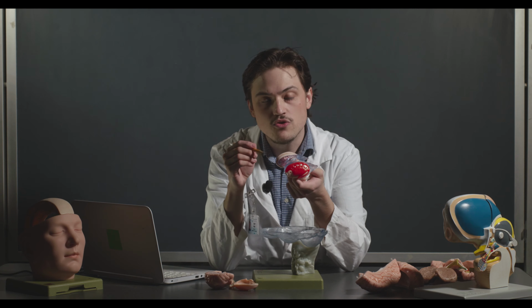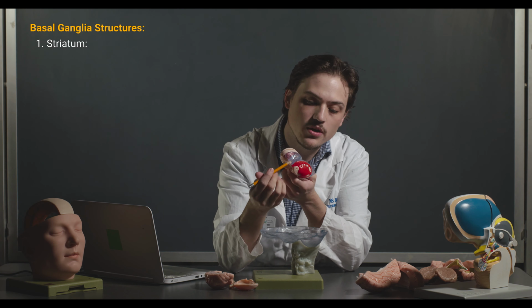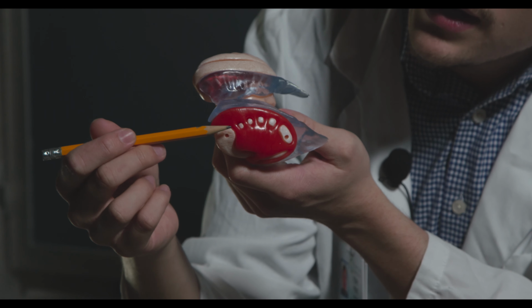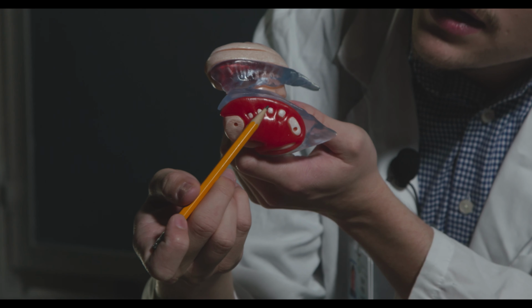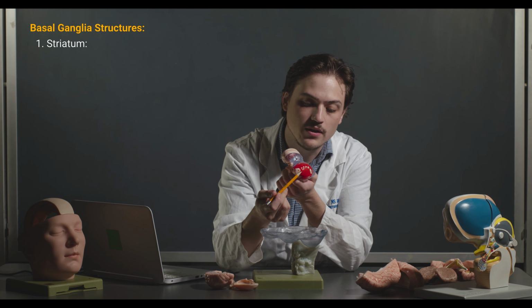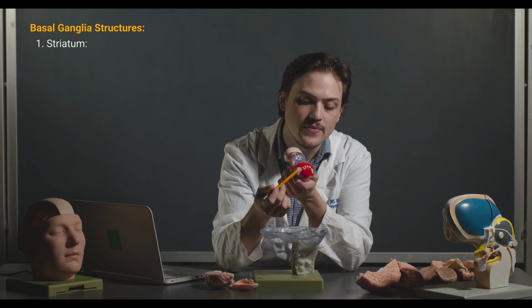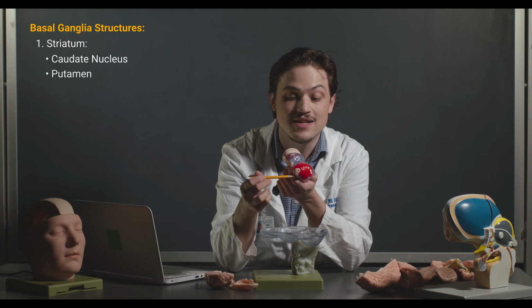Something that you should keep in mind with the basal ganglia itself, it usually gets referred to by a lot of different names, one of which is the striatum. The reason it has that name is because if you look at the caudate, which is this top part that wraps around, and the putamen, which is this middle part here, there's these little striations that connect the two. And these white matter fibers that you can see kind of peeking out that are coming through, that's the internal capsule. So if you were to look at this in a section, like a coronal section, like we saw during week 1, during the sheep brain dissection, you would actually see some of these striations, particularly if you had a stained specimen. So whenever you hear striatum, they're just referring to collectively the caudate and the putamen together.